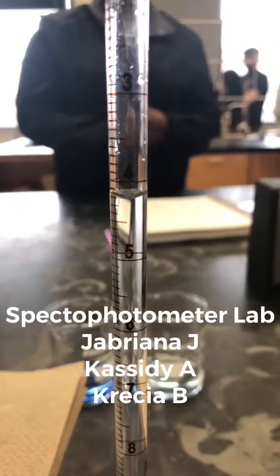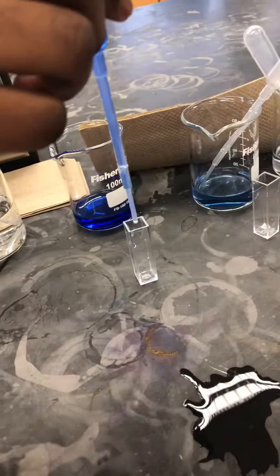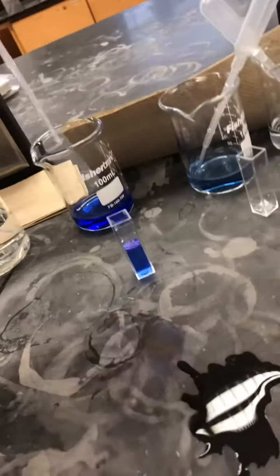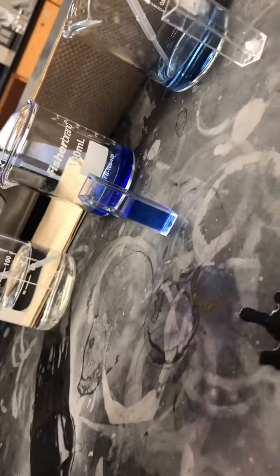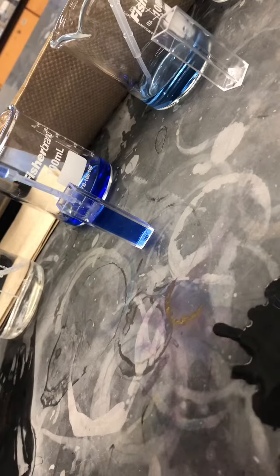Each dilution we had to insert into a cuvette. For this, we used the smaller plastic pipettes, which are less accurate. We pipetted them into the little cuvettes up to a line that is displayed to show where you should stop.